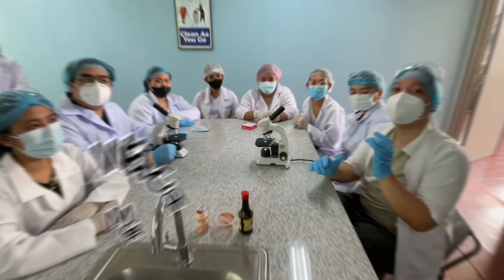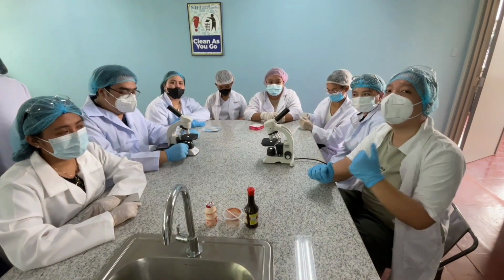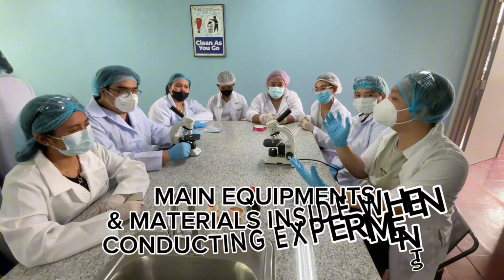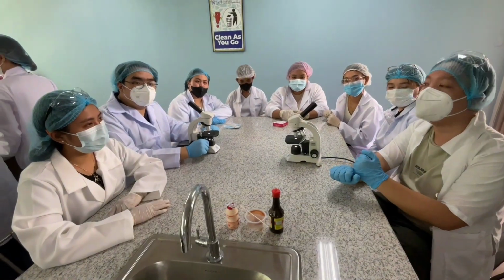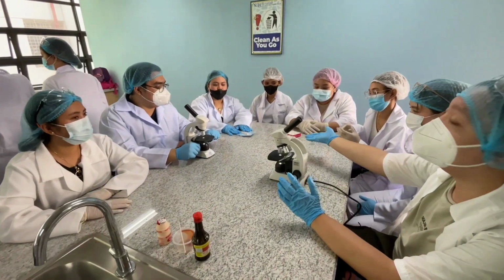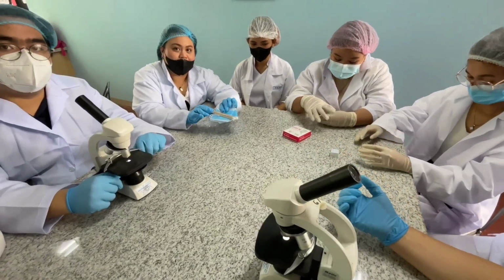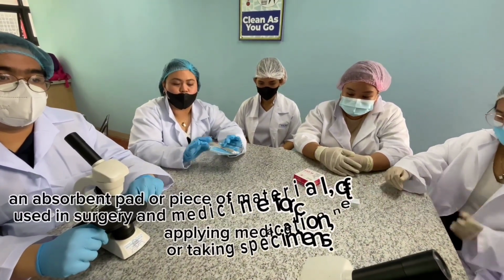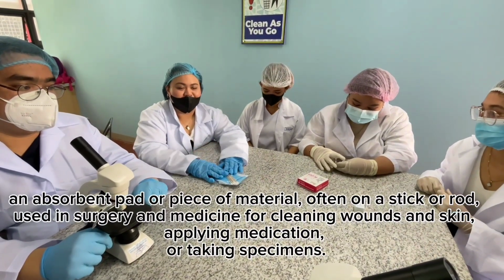Hi guys! Welcome back again to our chemistry laboratory, explorers. This afternoon, we will find out what the main equipments and materials are that we use when conducting an experiment. So first, we have our small materials. Can you name this one please? This one right here is the swab. It is used for us to transfer from one specimen to the slide. Thank you so much.